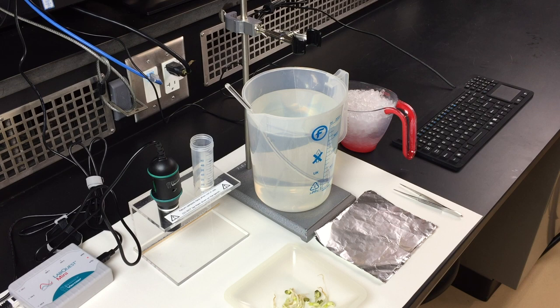For this experiment, we will examine the effect of two different temperatures on the respiration rate and metabolic rate of mung beans that have been grown in the dark.